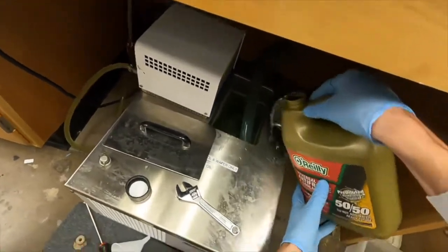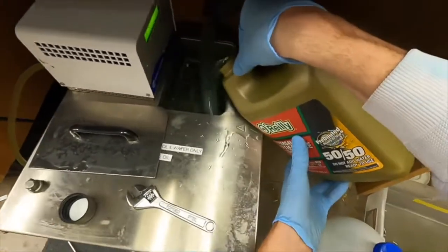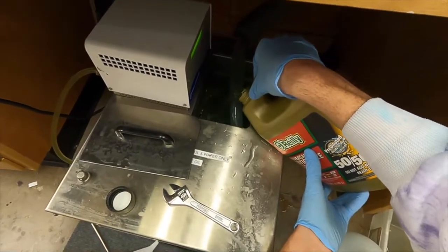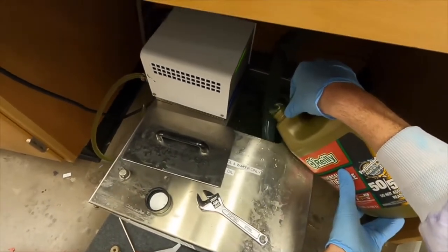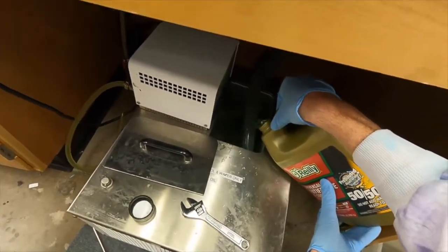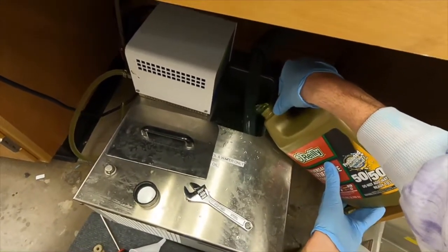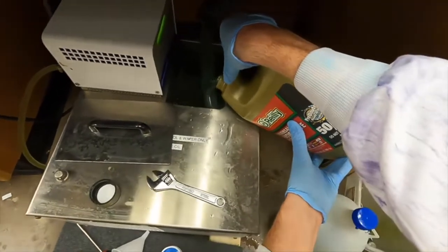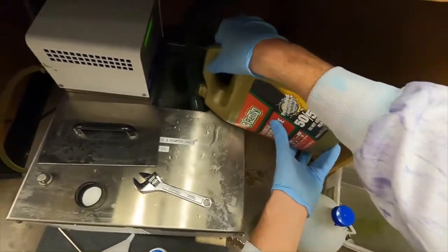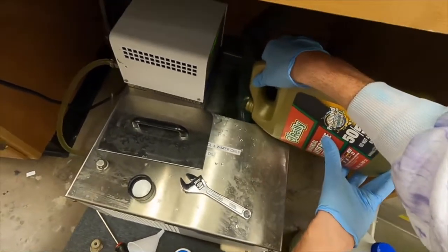The antifreeze level, you just slowly add some more. This is kind of a pretty rough process because sometimes it seems to take a lot more antifreeze than other times, but definitely at least this full bottle to fill up the entire reaction chamber.